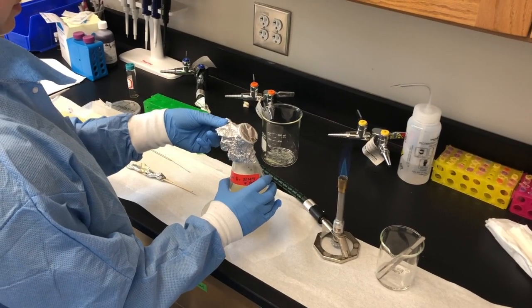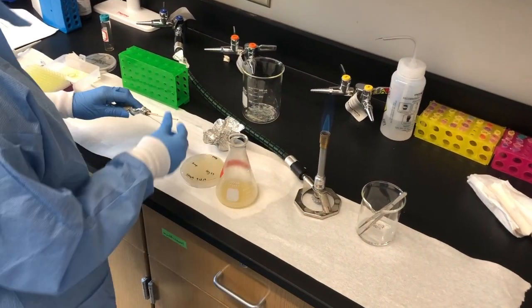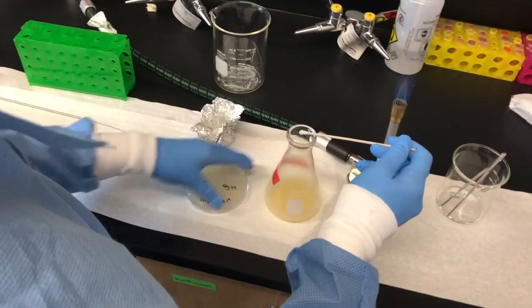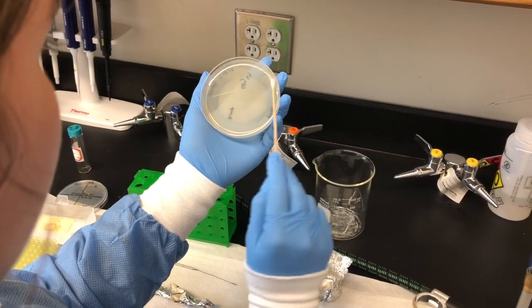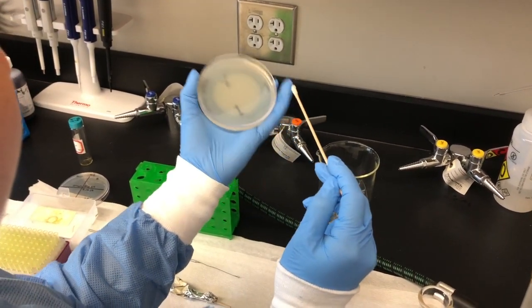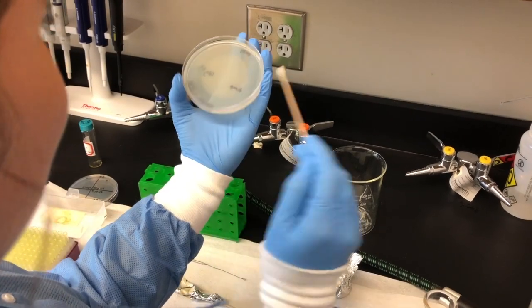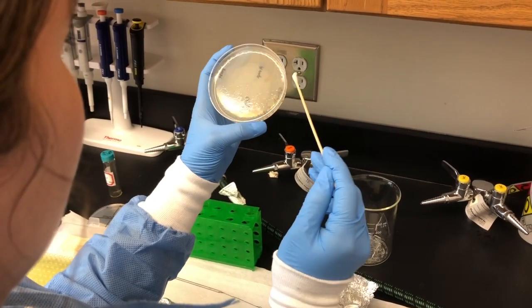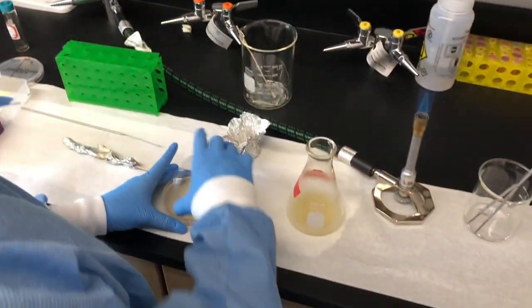The next assay is the Mueller-Hinton disc diffusion. Begin by taking concentrated overnight bacterial cultures and swabbing onto a Mueller-Hinton agar plate with a sterilized cotton Q-tip. Swab the entire plate and then repeat 3 times by turning 1/4 turn each time. Once swabbed, allow the plate to dry completely.